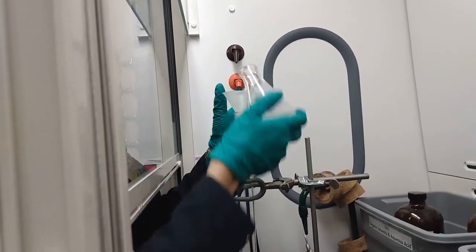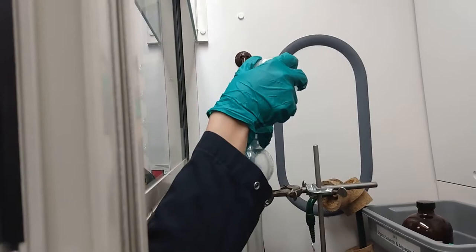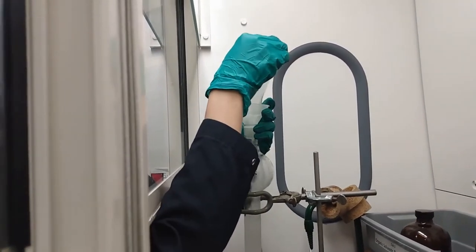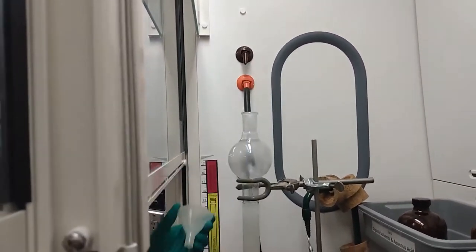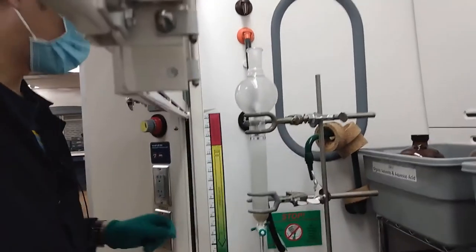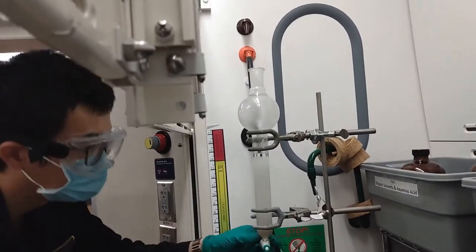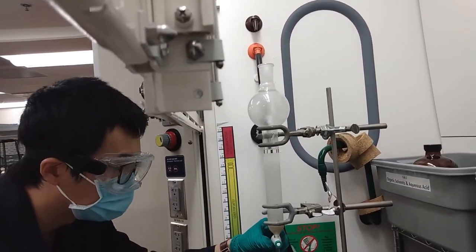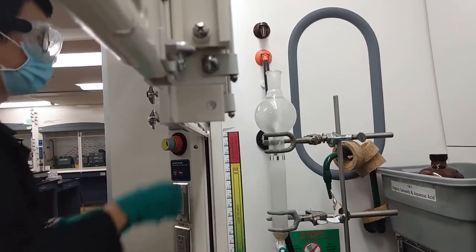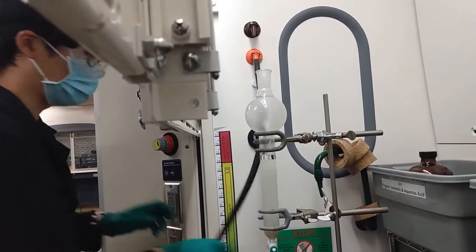Again, we can use air pressure to push it down to pack this column.